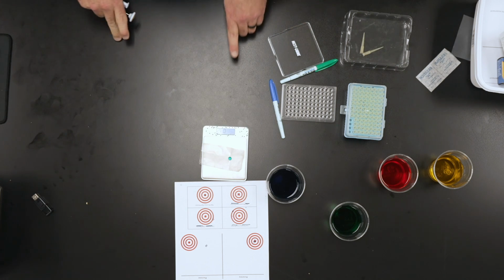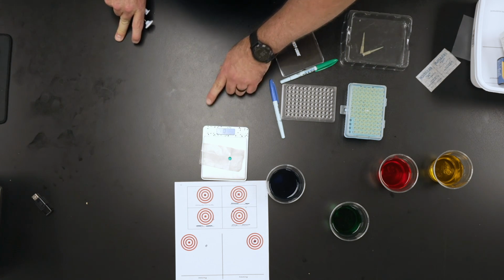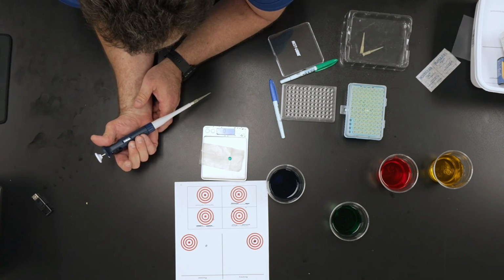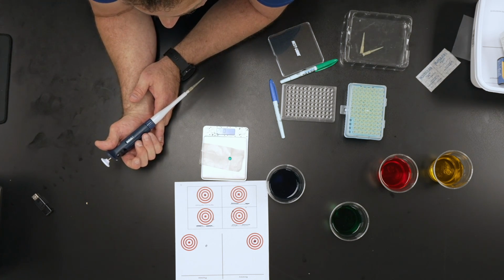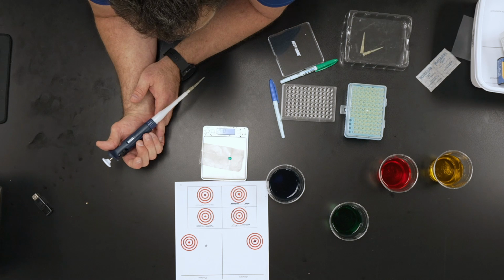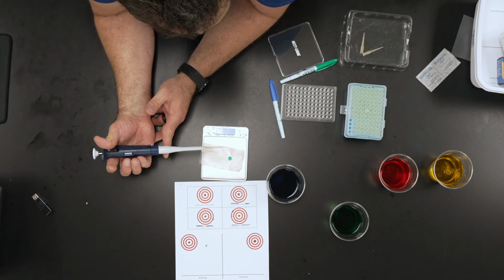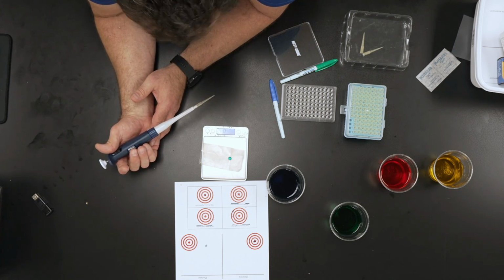So if you notice, that measures 0.12, which happens to be very, very accurate with the mass of 120 microliters. Not just very accurate; it's right on. Okay, am I good? It looks like the balance is good right now, and so far with just that drop, it looks pretty accurate.